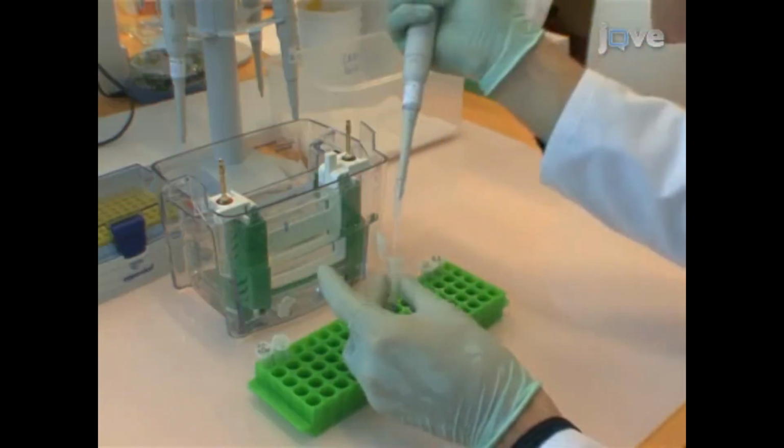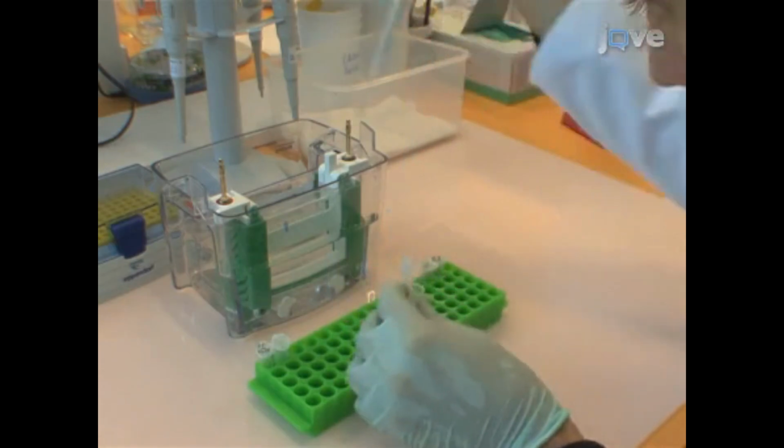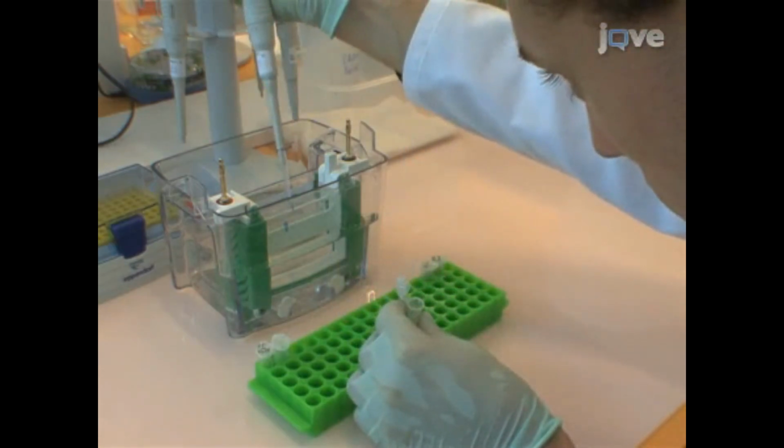Check the supernatant for proteins by performing an SDS page using 12% gels, loading about 12 micrograms of HSA conjugate into 1 gel slot.